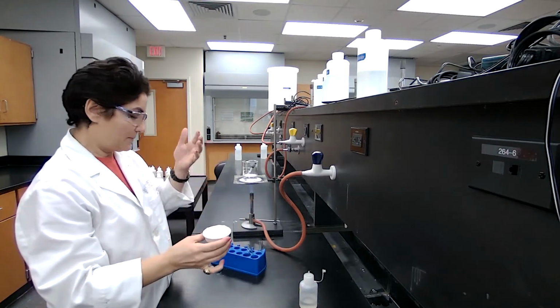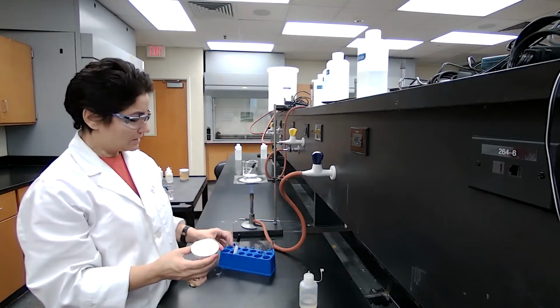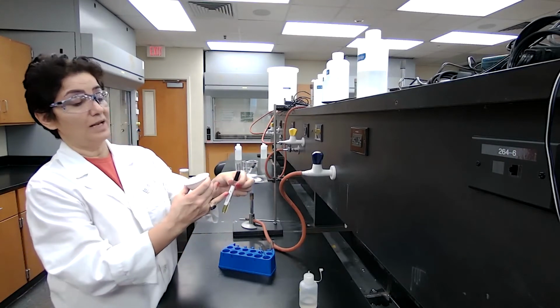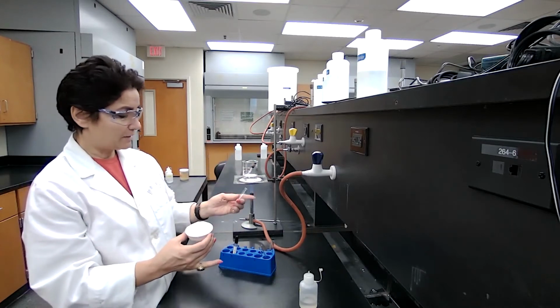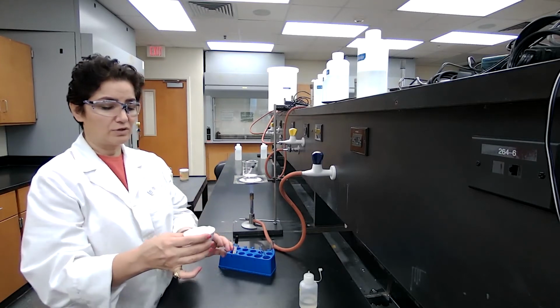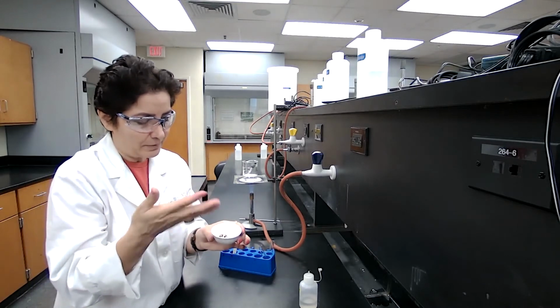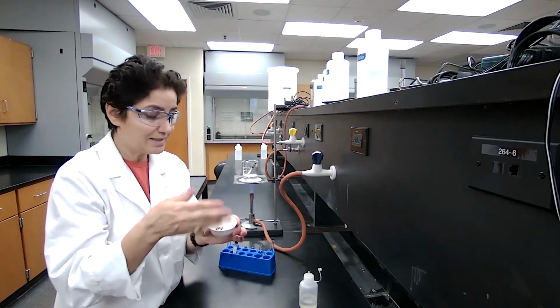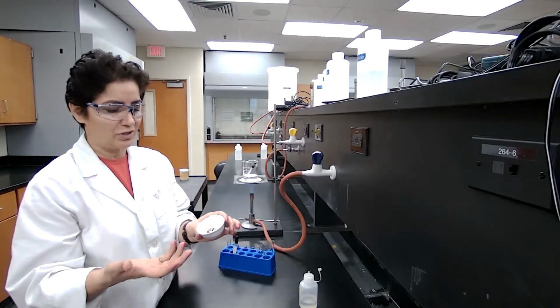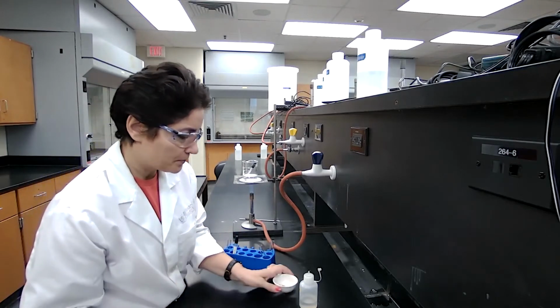What I mean by original is that before adding any reagent that will form the precipitation. So this is just the original unknown that is given, and they told me that the unknown label is unknown F. So I take a few drops and add a few drops of the sample into the sodium hydroxide, and I fan the vapor to see if there is any ammonia or not. Since the computer doesn't help you detect the odor, I have to give this information. There is no odor of ammonia in this case for this unknown.